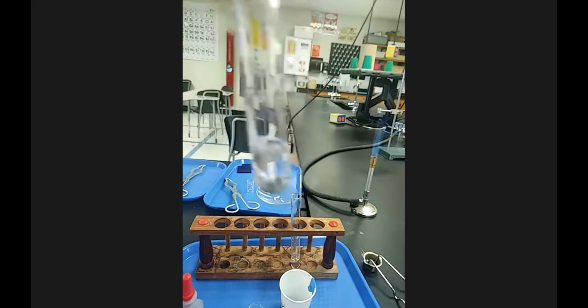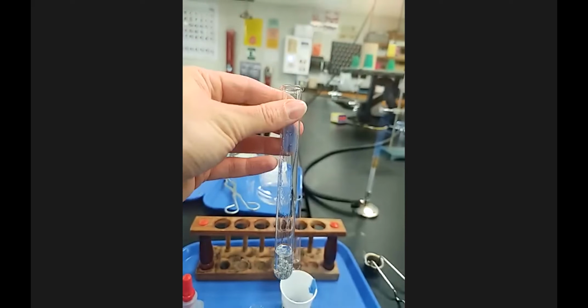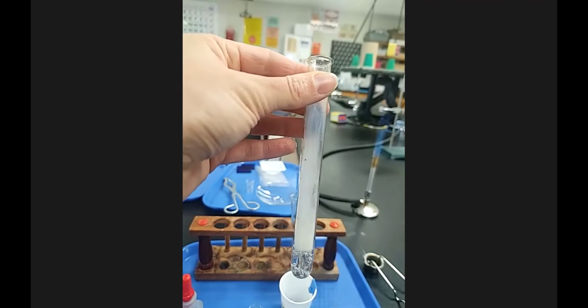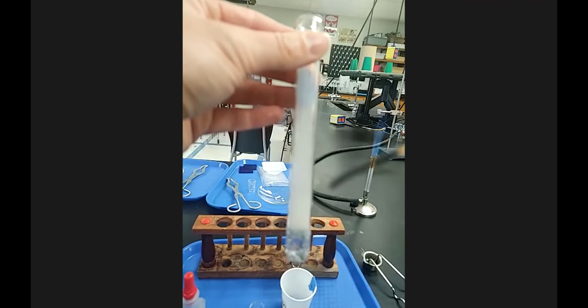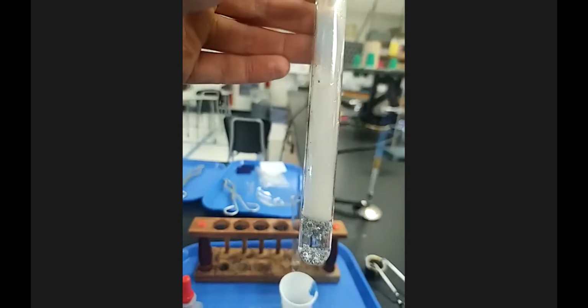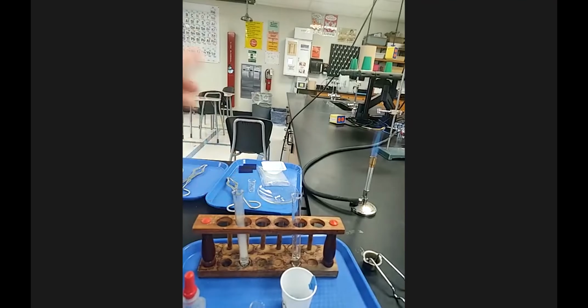All right, so burning splint here. Get my splint ablaze and put that in there. There was a slight, I don't know if you heard it, a slight squeak, and this went out. It's still just bubbling away, and I'm going to leave this. Now notice this is foggy right now. I'm going to let it sit for a little bit, and while I do the magnesium one, we'll come back to it.